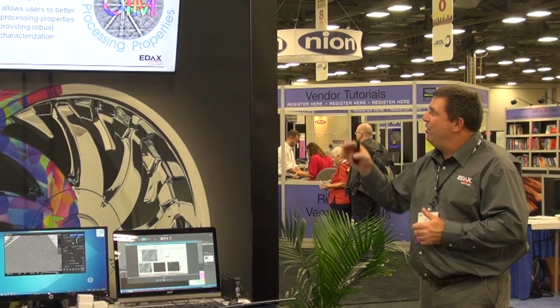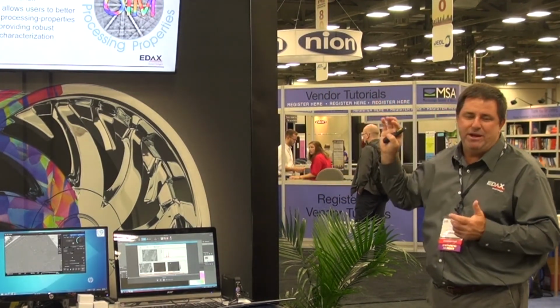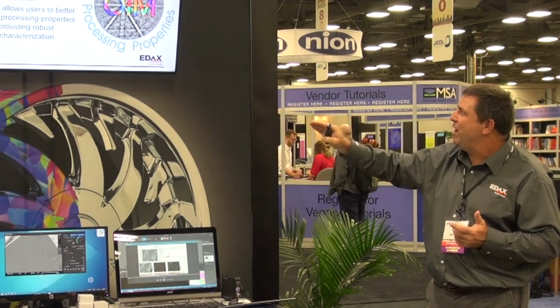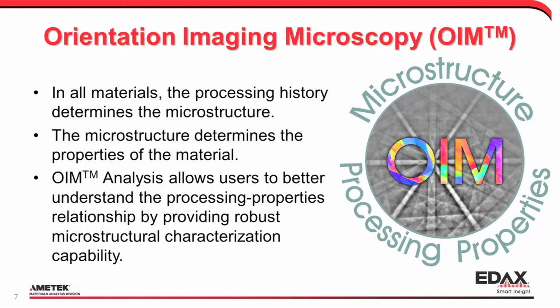And so OIM really falls in this place of how do we understand the relationship between microstructure, materials processing, and materials properties. And so OIM Analysis is the tool that's going to give us a lot of the different metrics to characterize the microstructure that we look at with EBSD.